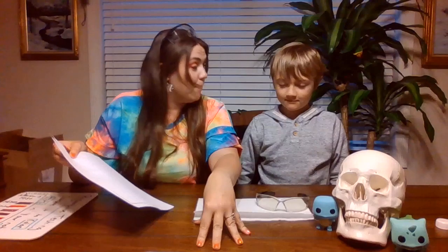All right, so here's the part where your assignment comes in. I'm about to start doing the lab with Max. He's going to help me do part of the lab. And then, while we're doing the lab, you're going to fill out the lab that I gave you in Canvas. The first 2 pages are information you'll probably need to answer the questions, but there's nothing to write down there, okay? The second 2 pages you will fill out.